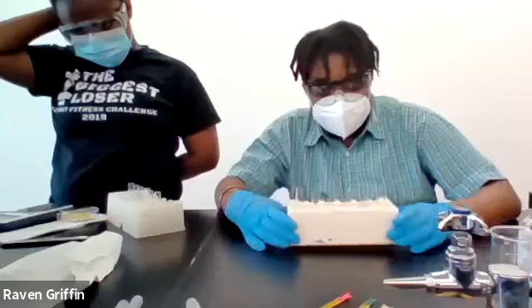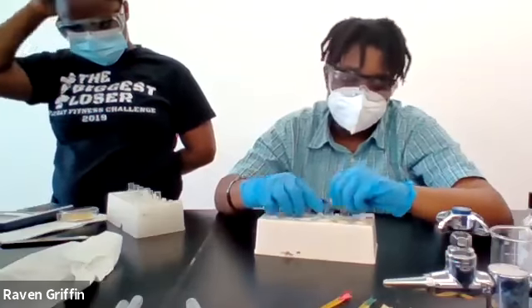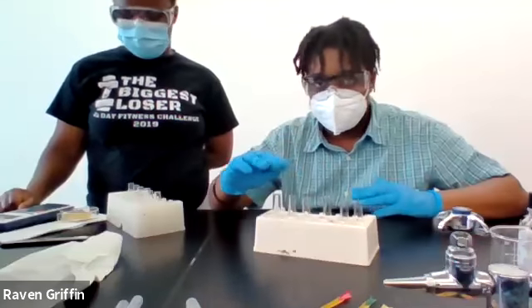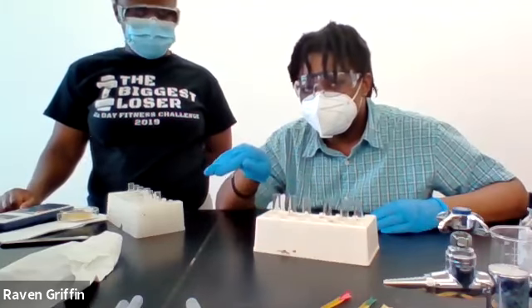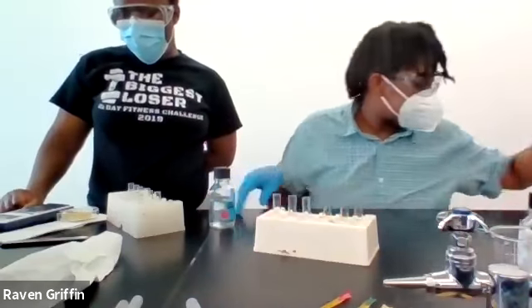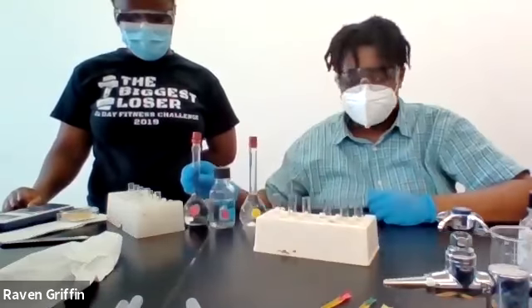So then the last part now, D3. We have 3 tubes with magnesium, Mg, another 3 with copper. What we're going to do is see how magnesium and copper react with the 3 different acids that we have. They're all going to have the same concentration, but they're 3 different acids. This is a 3 molar sulfuric acid, the 3 molar hydrochloric acid, and the 3 molar phosphoric acid.